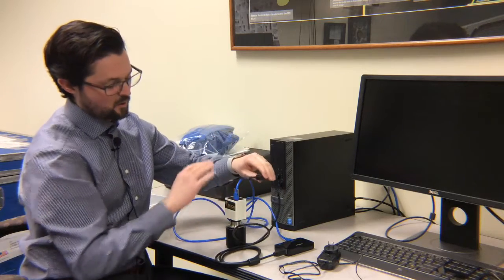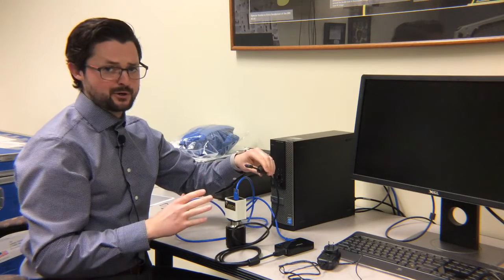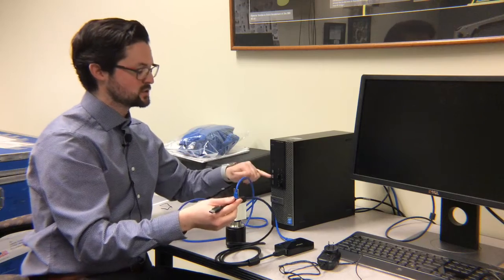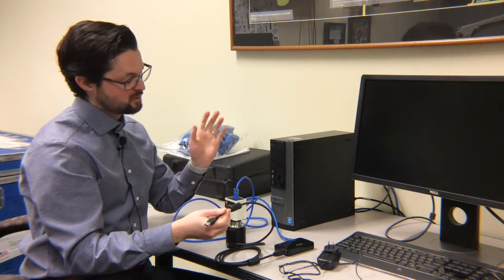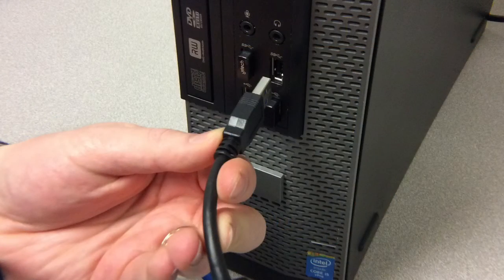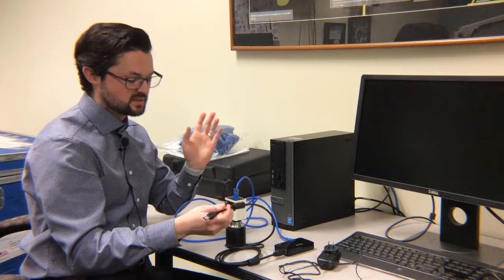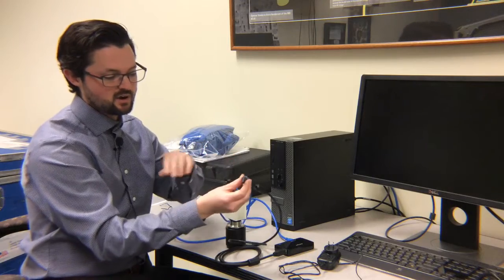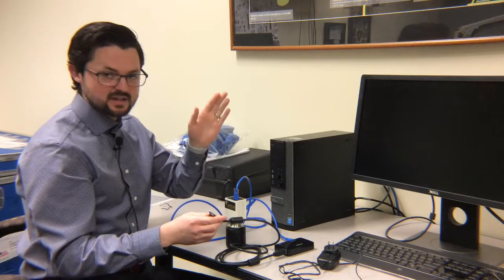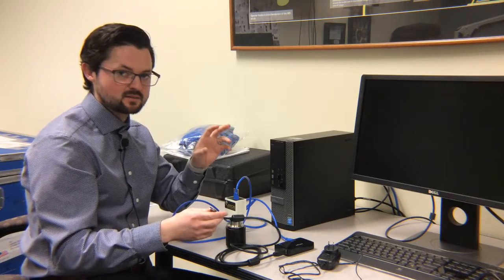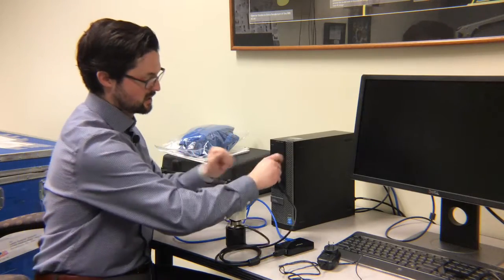A quick note, this whole setup is USB 3.0, so it needs to plug into a USB 3.0 port on your computer. USB 3.0 is labeled. Oftentimes it'll have blue on the USB component itself, but other times it'll be labeled just with an SS, the USB icon with an SS. You just plug into that.